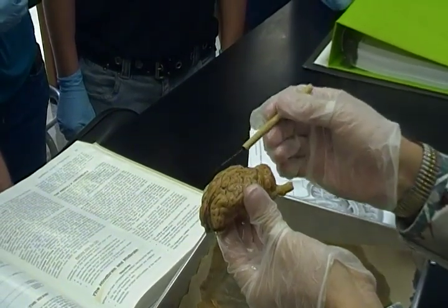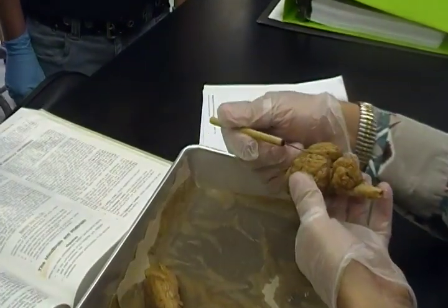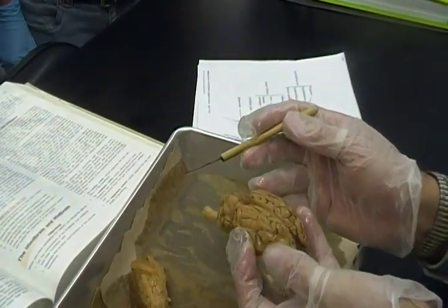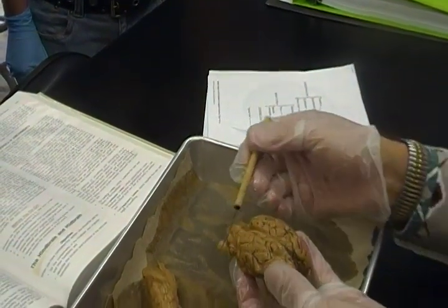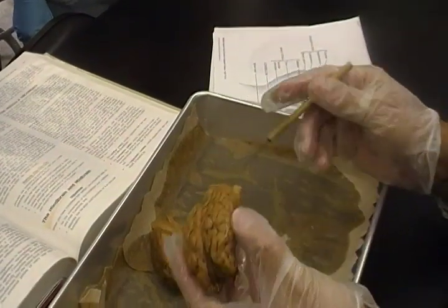Then this has got to be who? Cerebrum. Okay. Now remember your lines. We got a line coming right down the middle. Longitudinal who? Fissure. Okay. Across the back, you told me this is the cerebellum. You told me that this is the cerebrum. So what's this got to be? Transverse. Transverse fissure. All right. We picked out those two things.